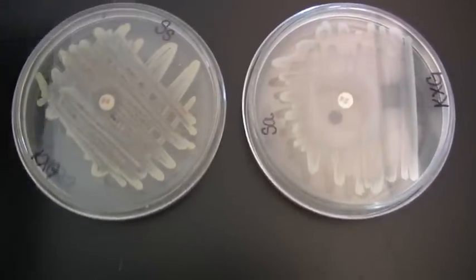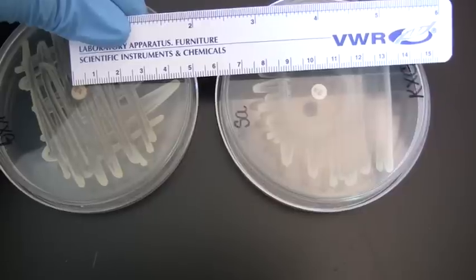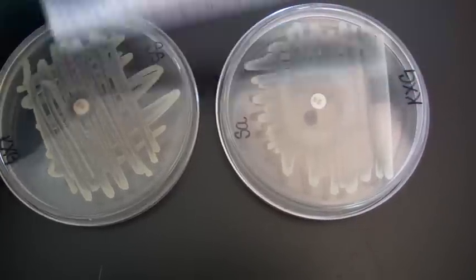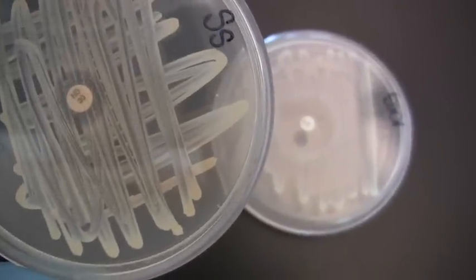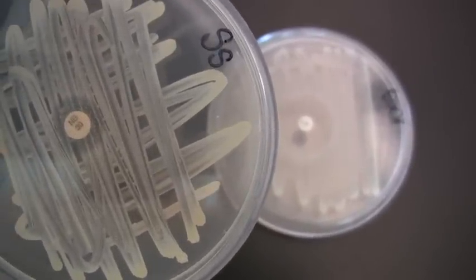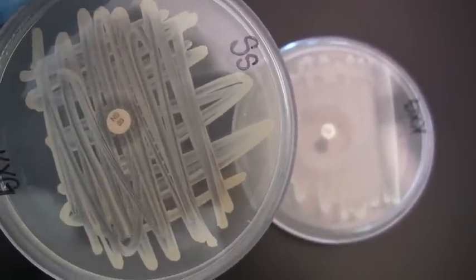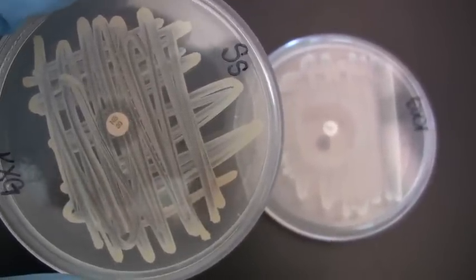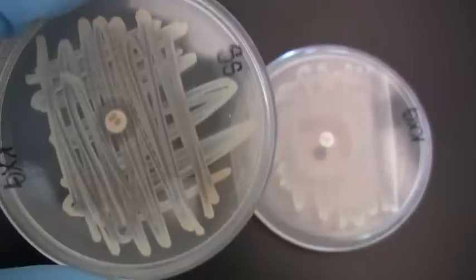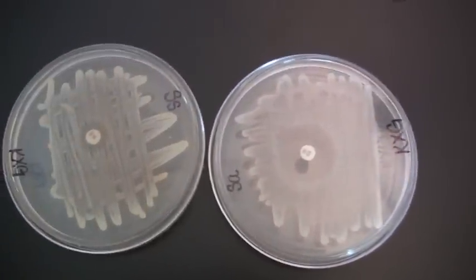And so looking here on the inches side, let's turn around. Looking here, we only see that this is actually a few millimeters. So that's not enough for this to be considered antibiotic sensitive. And also, if we look closely, there actually are a few colonies that are forming growth really pretty close up to the disc. In some cases, you'll see solid growth. You won't even see any effect whatsoever by the antibiotic disc. So this organism would be considered antibiotic resistant because it completely grows up to within 16 millimeters or less of the disc. An organism that is antibiotic sensitive is going to have a much larger zone of clearing.